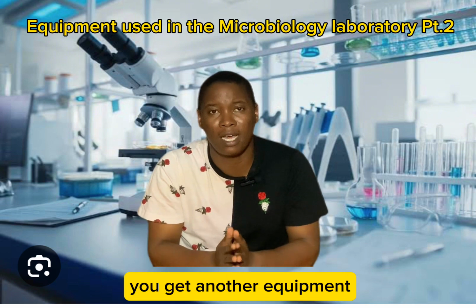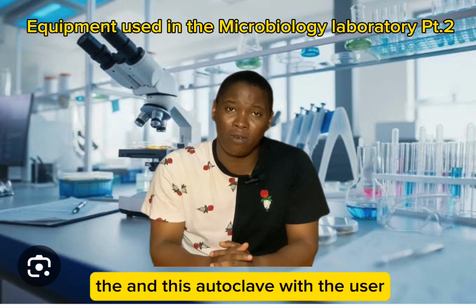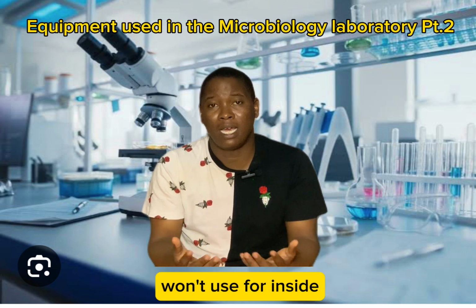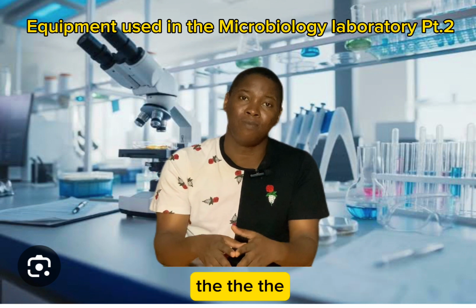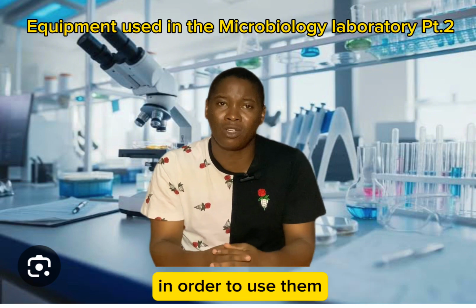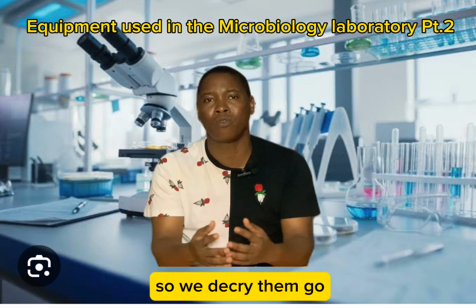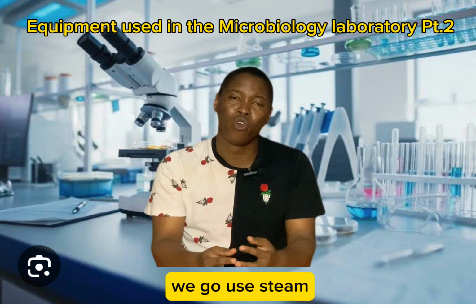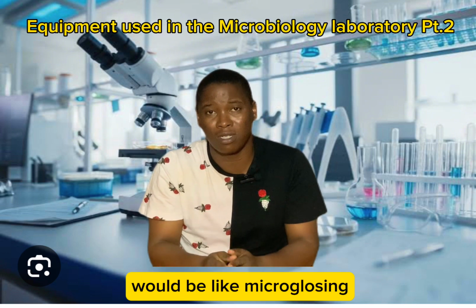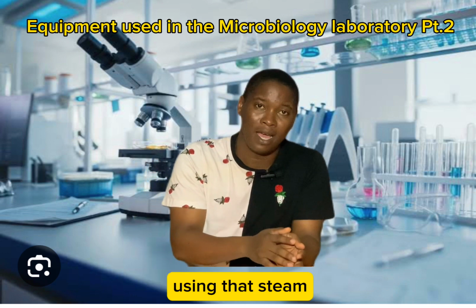Now after incubator, you get another equipment wey we dey call autoclave. Different types dey, big one dey, small one dey, and this autoclave we dey use am do wetin we dey call sterilization. Now any equipment wey we wan use for inside a laboratory, many times many of our equipments dem dey made up of metal or glass. Now many of these equipment, in order to use them, we no want any microbial contamination for inside all these equipment, so we dey carry them go for inside autoclave, where we go use steam at high pressure to destroy anything wey be like microorganism, whether it be their spores or their cells.